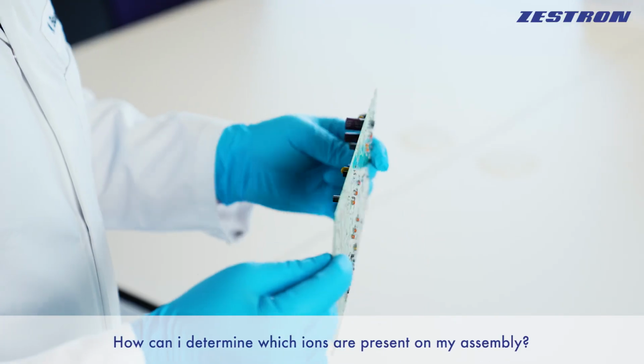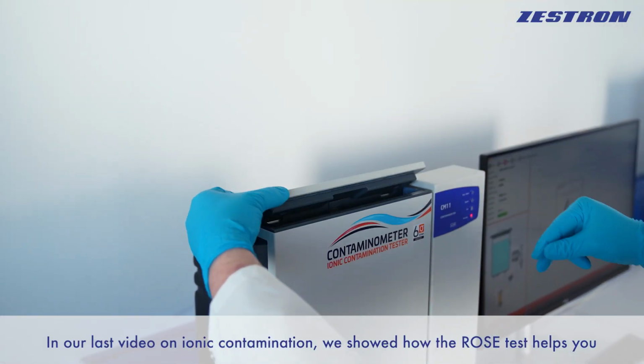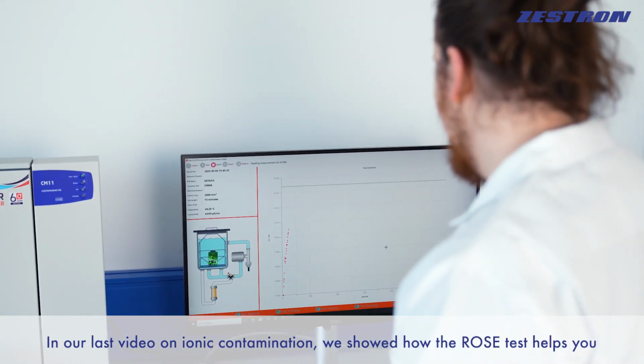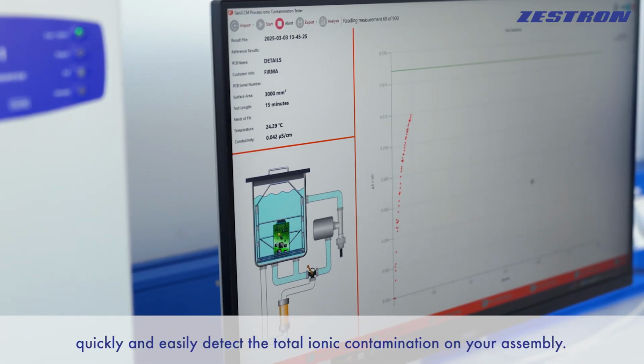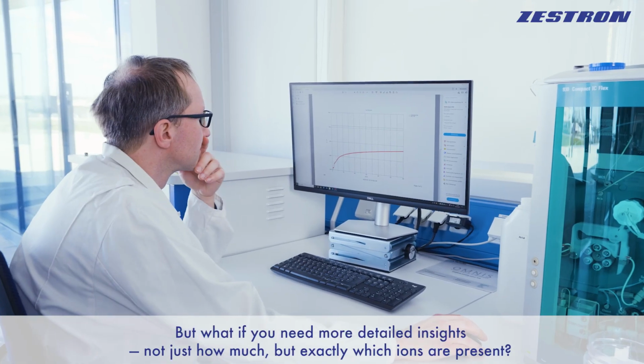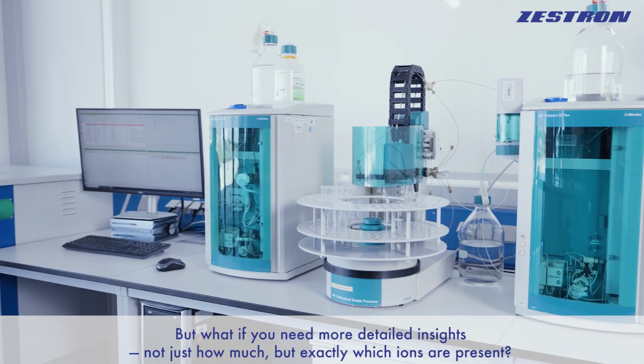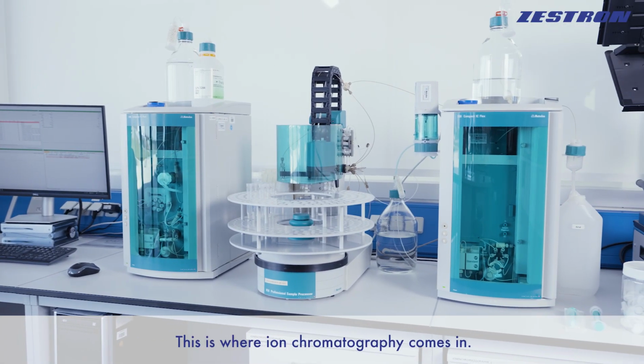How can I determine which ions are present on my assembly? In our last video on ionic contamination, we showed how the ROSE test helps you quickly and easily detect the total ionic contamination on your assembly. But what if you need more detailed insights, not just how much, but exactly which ions are present? This is where ion chromatography comes in.